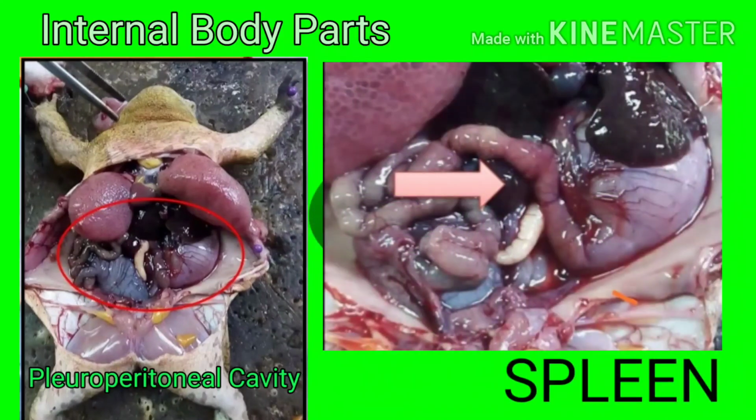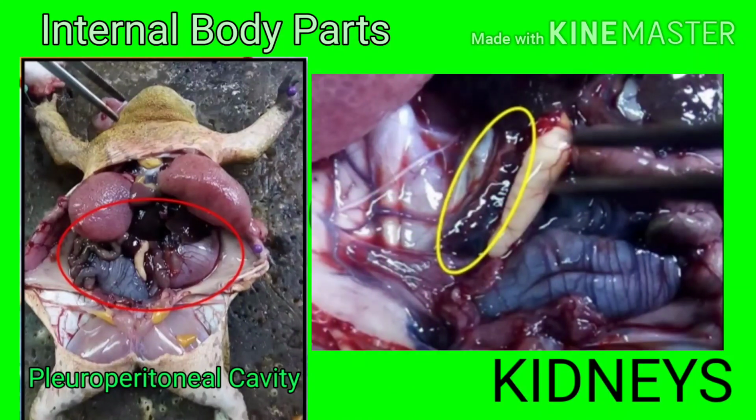Next, we have the spleen, a rounded dark red gland embedded in the mesorectum. The mesorectum is a mesentery which suspends the large intestine to the dorsal body wall. The spleen synthesizes antibodies and helps in immune response and blood filtration. Next, we have the kidneys, which are flat, elongated organs with a dark brown color. This filters the blood, removes waste, and controls the body's fluid balance.